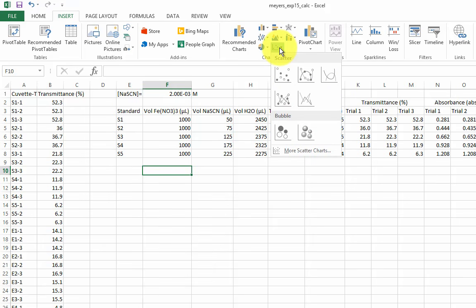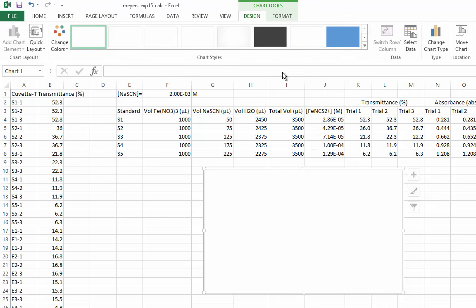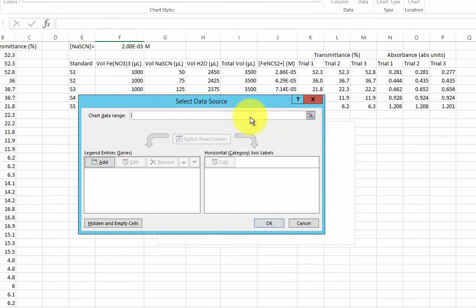As a general tip, if you are going to be doing a linear regression and showing the best fit line, choose the scatter plot without connecting lines. Sometimes Excel will automatically add data into the plot. I prefer to add the data manually, so I make sure it's what I want. You can add, remove, or edit the data by clicking Select Data in the Design tab.